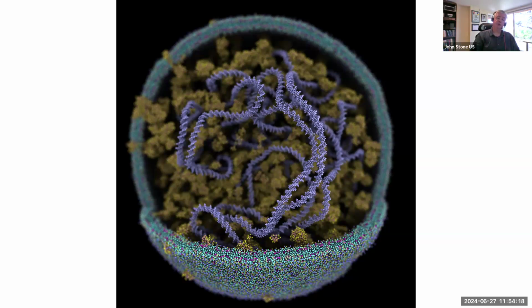Then there is a GPU version of Tachyon. That is what's built into VMD, and that is interactive, but for a static scene. That means you can rotate the scene around, change the lights, turn various rendering features on and off, all that kind of stuff. More like what you do in Blender, right? It is interactive in that it may display at 30 frames a second, and that's all fine, like a scene like this, for example.